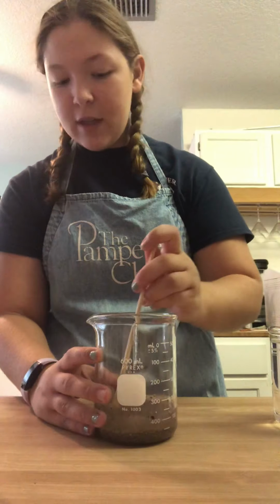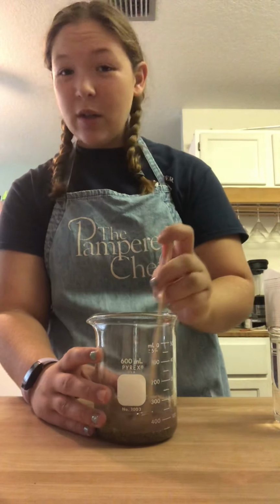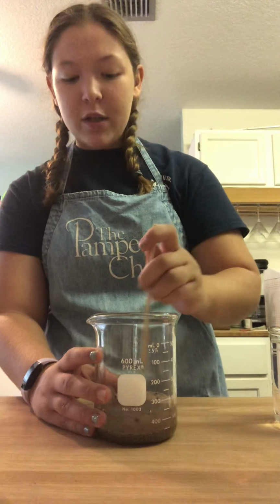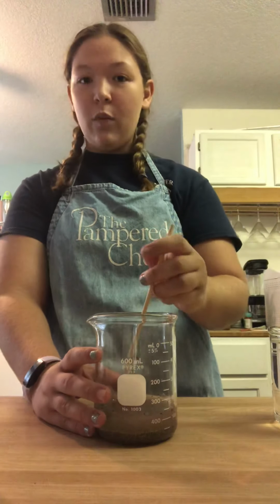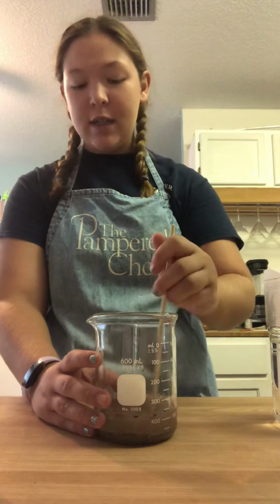Now with beach sand, there is, like, a salt spray. So if we were to calculate how much actual salt there was and then how much salt we got at the end of the experiment, there might be an increase there.